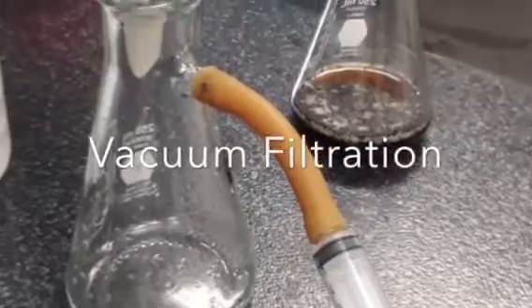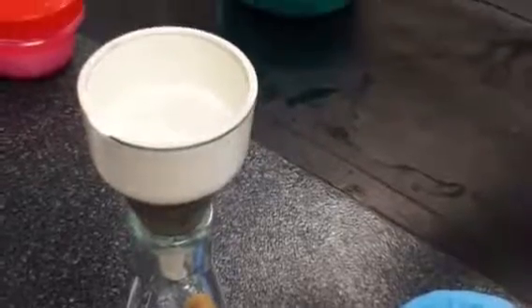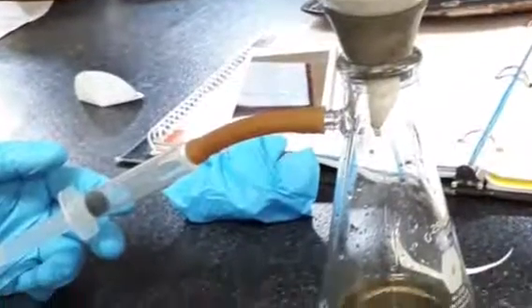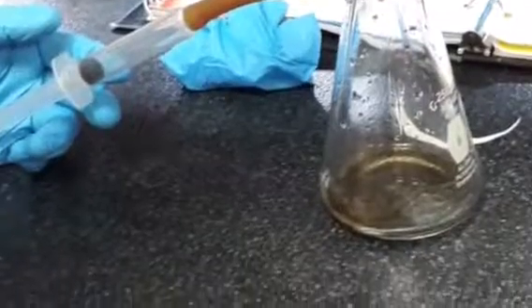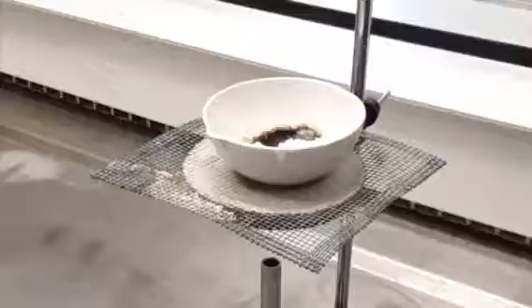For this process to work, it is necessary to verify that the filter paper covers all the holes of the Buchner funnel, moisten the paper and empty the mixture of soda and activated carbon. This filtration happens because of the pressure caused by the syringe.